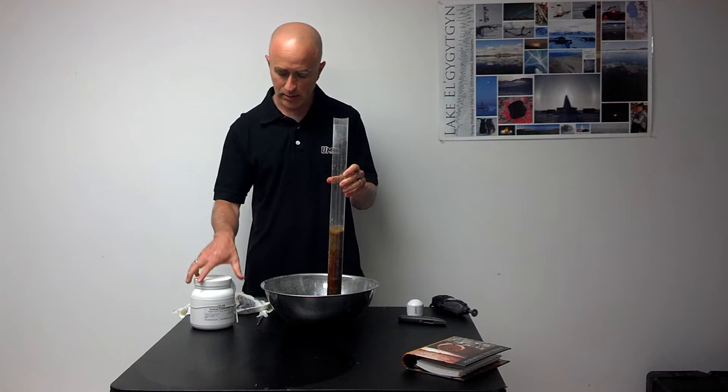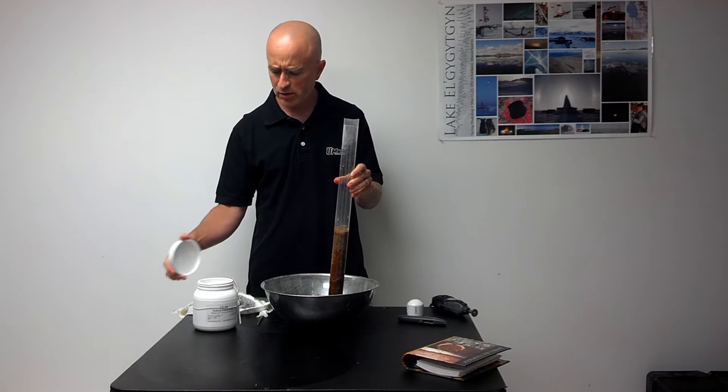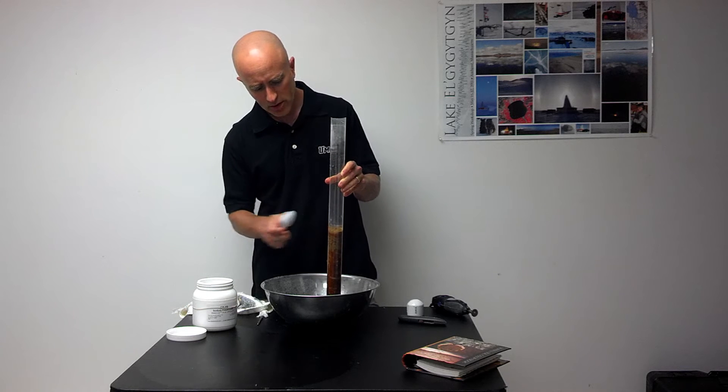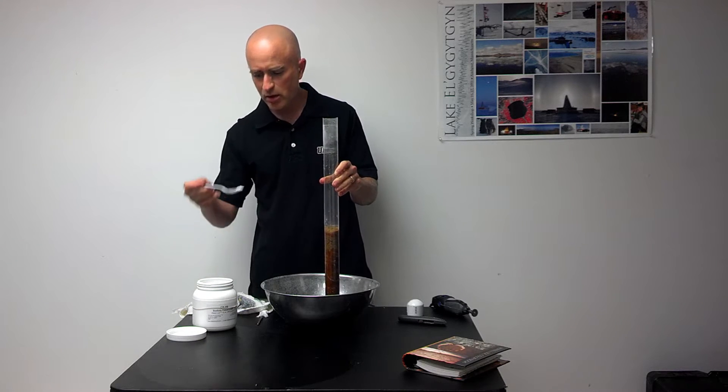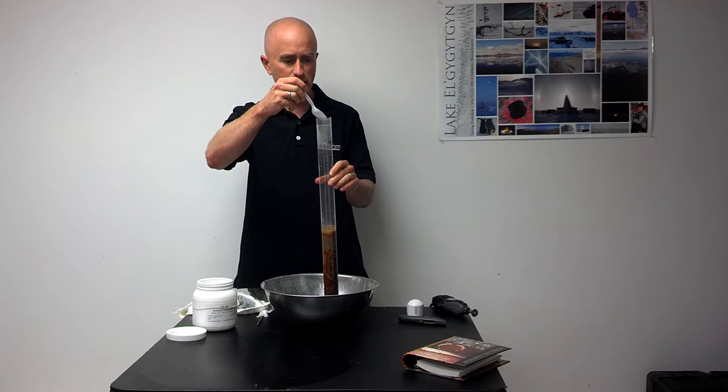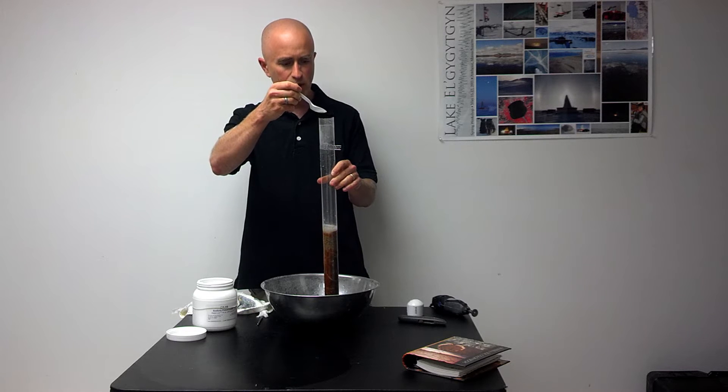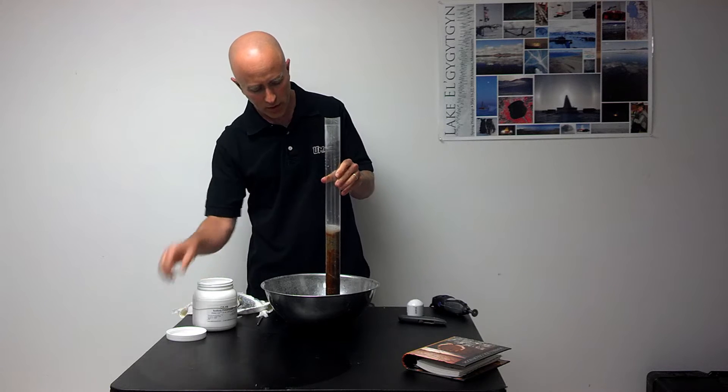Once the water is drained off the top of the sediment, we'll use some sodium polyacrylate, sometimes known under the brand name Zorbitrol, to soak up excess water at the top of the sediment. I'll take a small amount of this very water-absorbing material and sprinkle it on top of the water, and it turns the water into a gel.